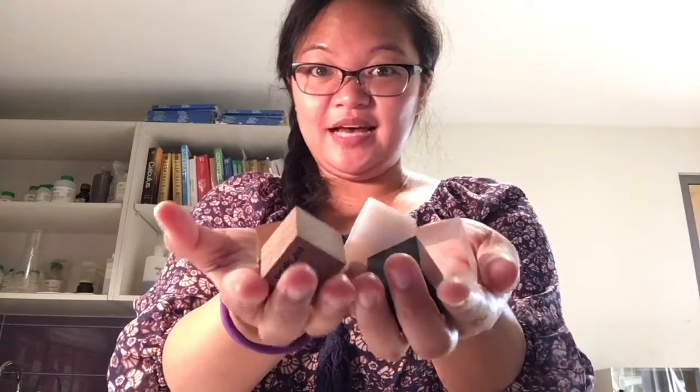We're going to figure out what their densities are based on their mass and their volume. All 5 objects are literally the same size and shape. So because they're all the same size and shape, we're just going to measure the volume of one of these and use that volume for each of the 5 objects.